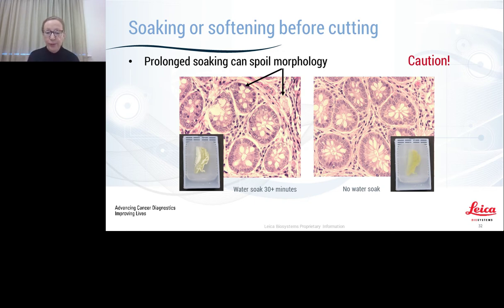And here's an example, one that we created ourselves. This is exactly the same block. The one on the left-hand side has been soaked in water for over 30 minutes. The one on the right didn't have a water soak, just placed onto a cold plate and cooled down. And you can see the effect of water seeping into a block, even though clearly the block was well processed, but it does cause some distortion to the morphology.